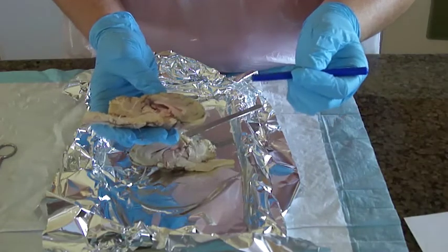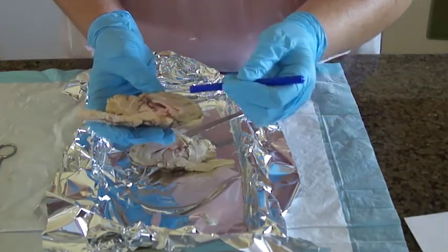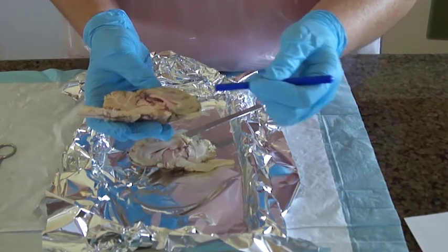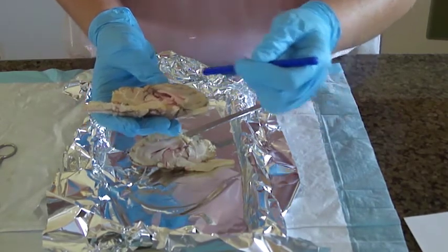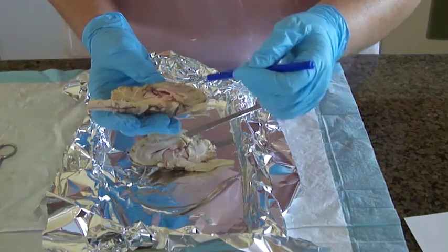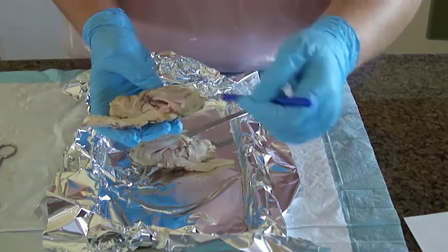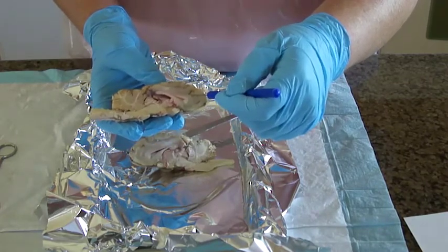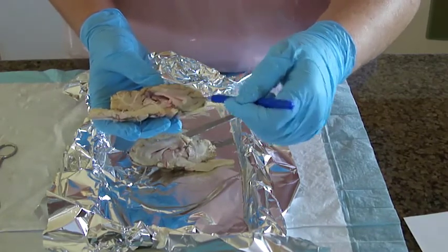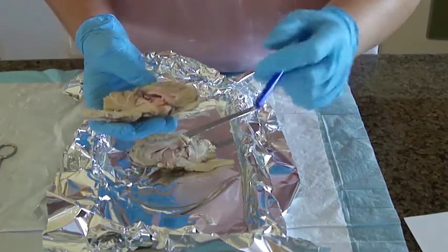And in here we can see the dura mater is under here. Then there's the arachnoid that lines underneath it. There's the pia mater that comes in and kind of goes down into, it's like a fissure, but it's lower than the dura mater. And then there's the cerebral cortex, and then into the white matter.